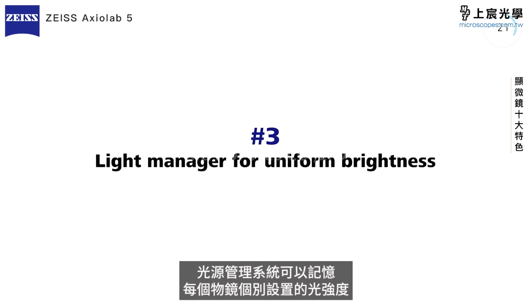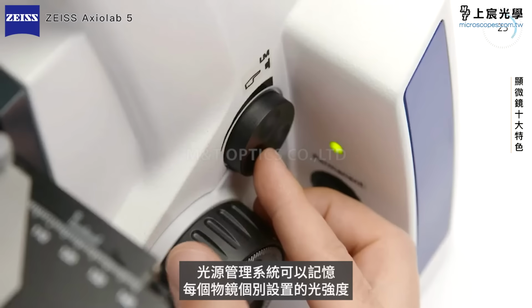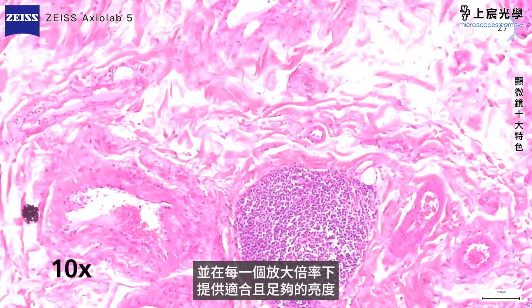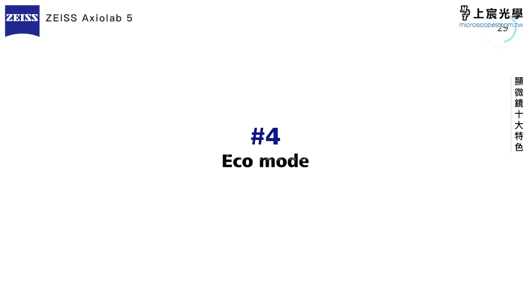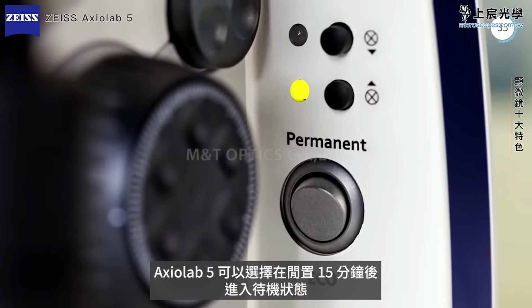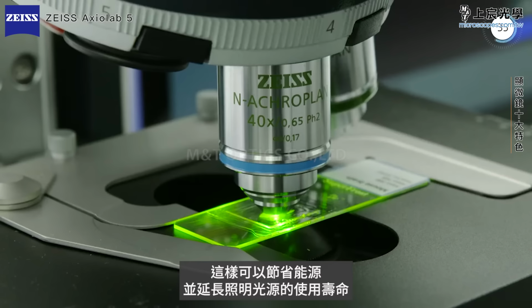The Light Manager memorizes the individually set light intensity per objective and provides uniform brightness at all magnifications. Axiolab 5 optionally goes to standby after being idle for 15 minutes. This saves energy and extends the lifetime of the illumination.